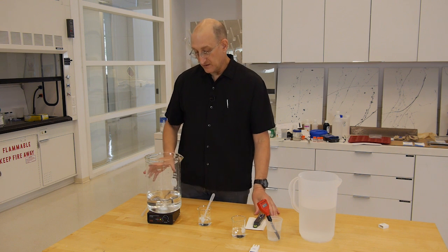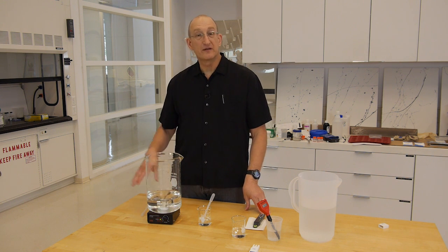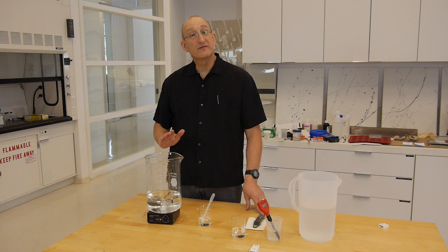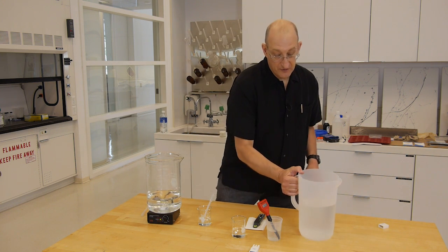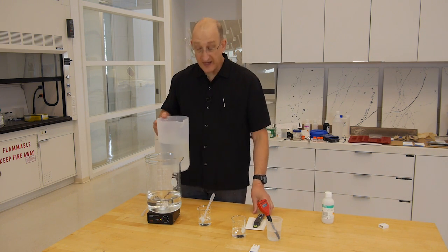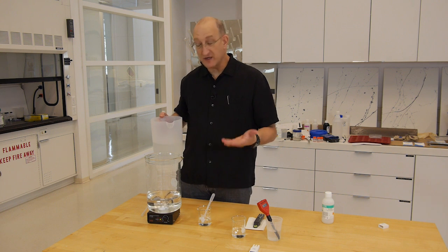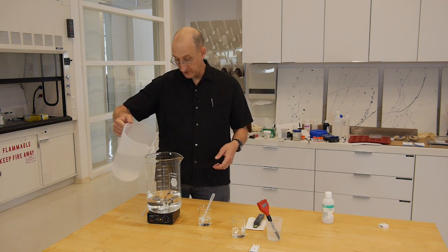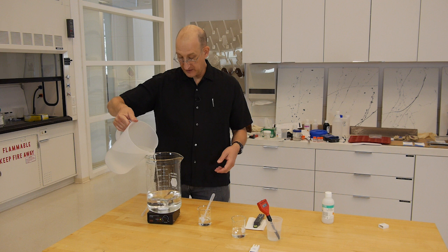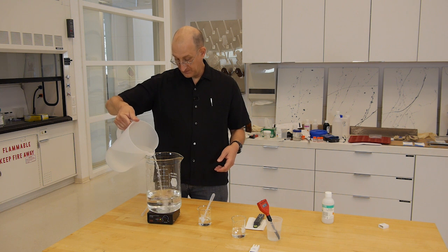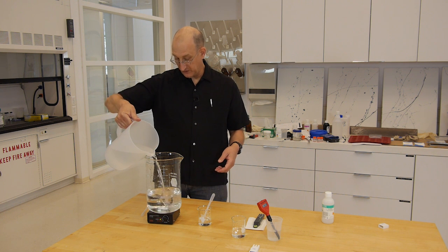Remember that while ionic strength is linear with dilution, conductivity isn't. So to go from 10 to 6 will probably be more than doubling the volume of the water. So we'll start with maybe another 500 milliliters and see where we are.